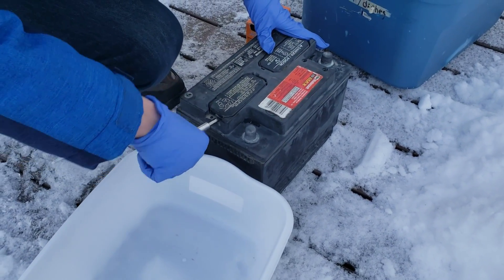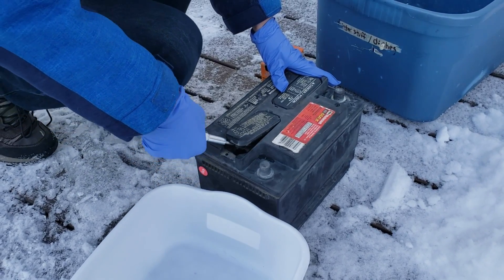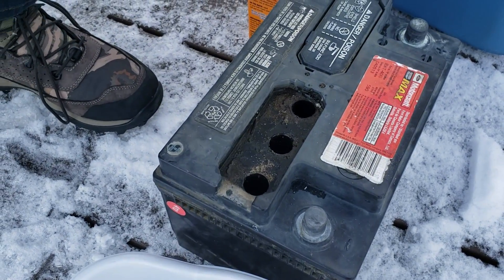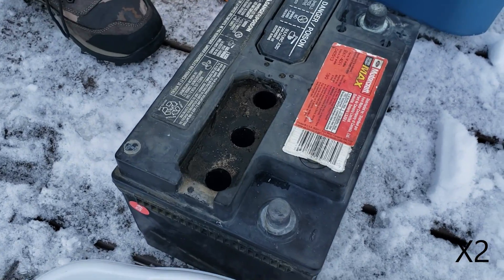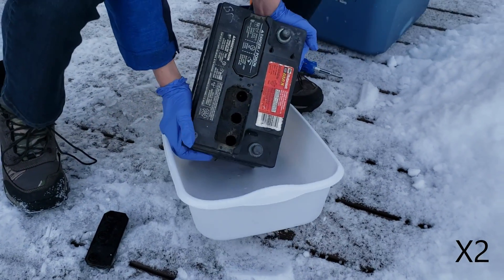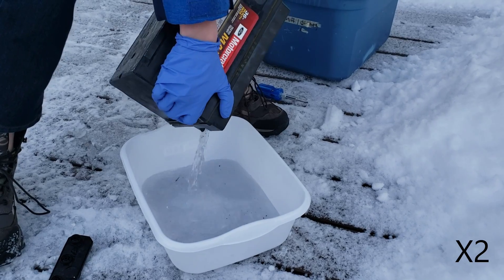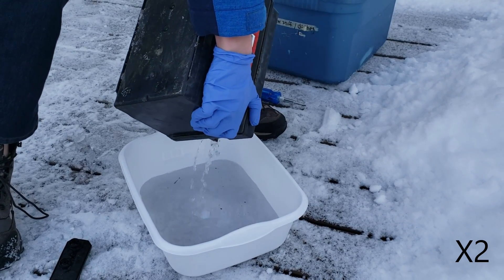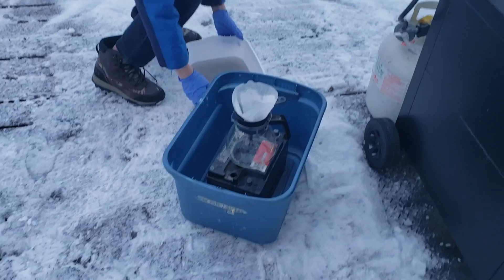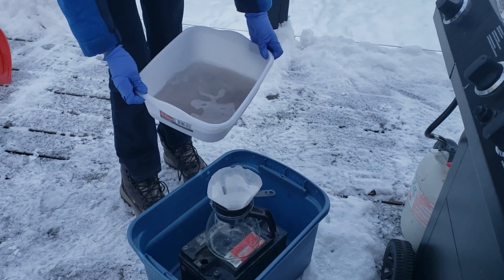As you can see here, I am wedging open the caps on the car battery with a screwdriver and then pouring it out into my bucket. While you're looking at me struggle to lift a car battery — hashtag skinny — you should know that there's more car battery acid underneath the other caps, so I recommend opening all caps on your car battery. Right now I am just straining the car battery acid with a coffee filter to remove any junk that may be found.